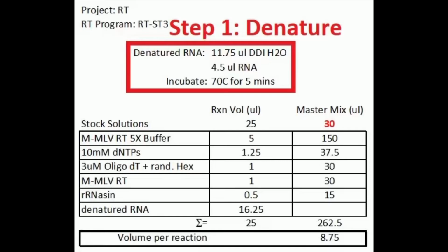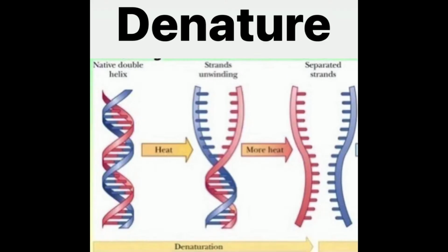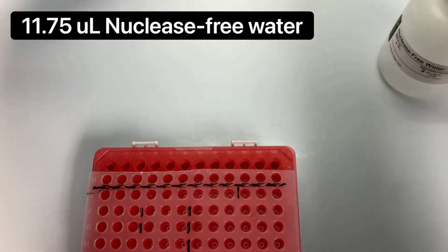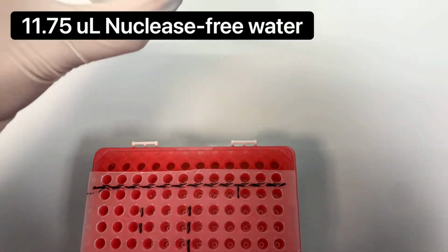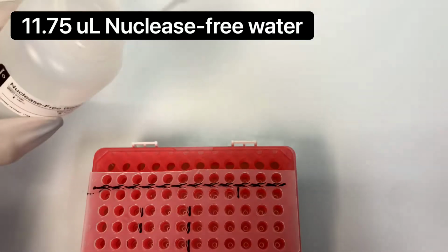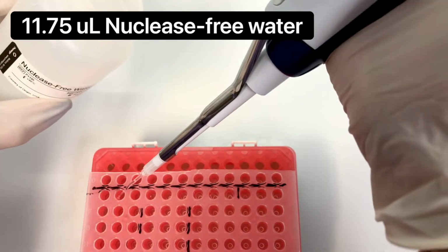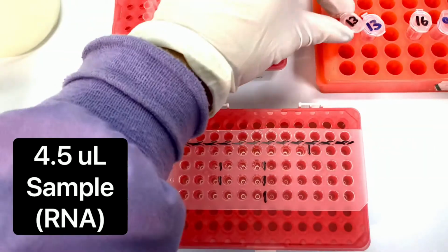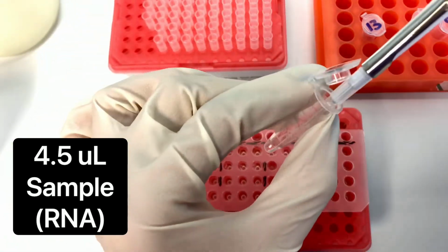Prior to running RT-PCR, we must first denature our RNA. Denaturing is when we subject the RNA to heat to produce single-stranded RNA. Start out by adding 11.75 microliters of nuclease-free water into the wells of a PCR plate. Then take 4.5 microliters of your sample and add it to the well.